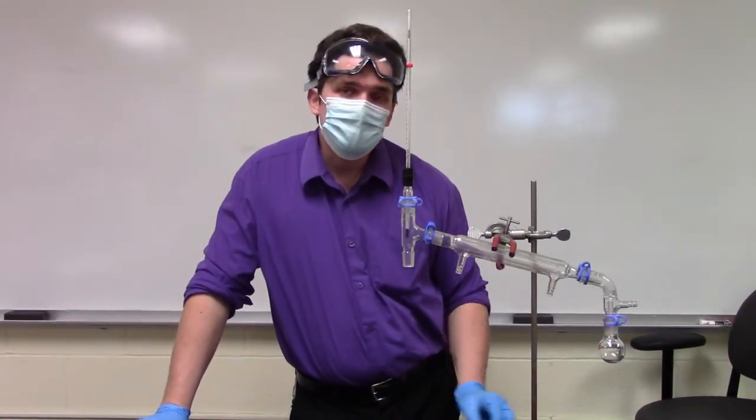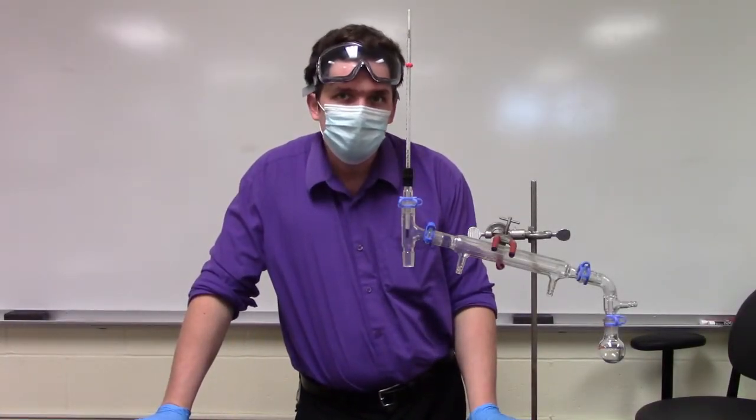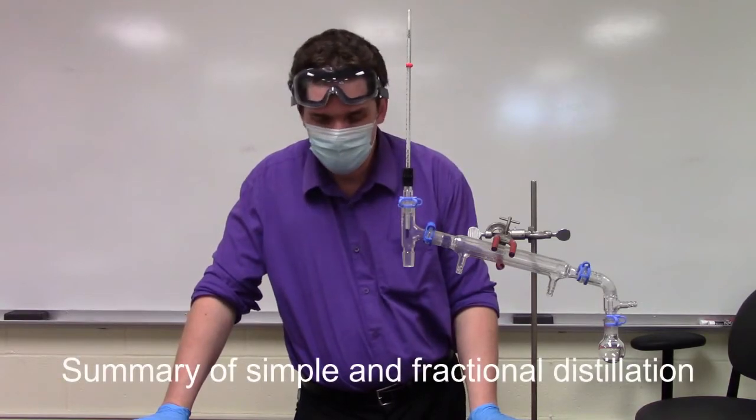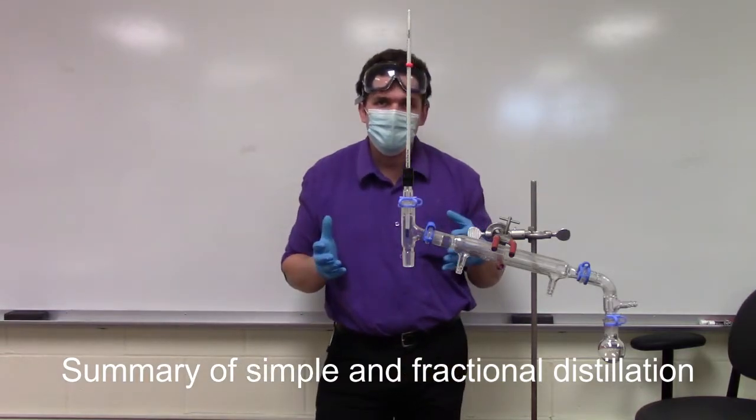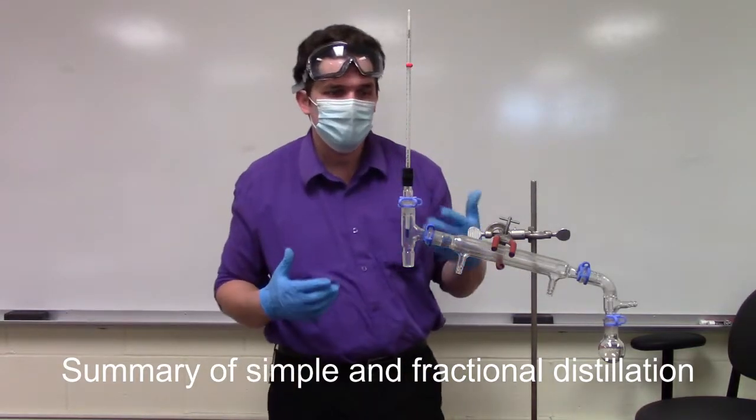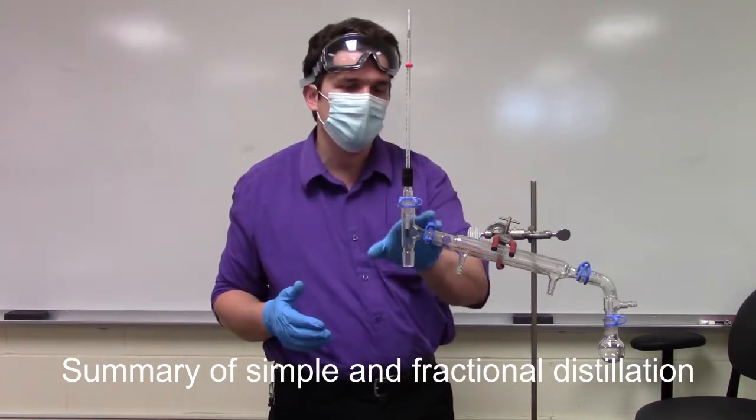Alright, so let's do a simple summary of simple, fractional, and packed column distillation. Now, when we do distillation, the whole point here is to separate two compounds that have different volatilities. So a simple distillation apparatus is kind of what you see here.